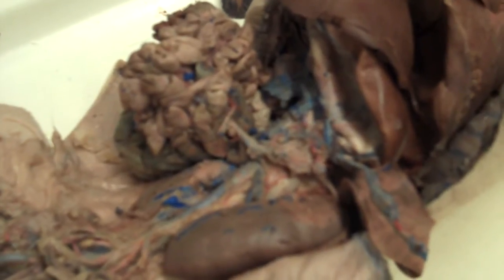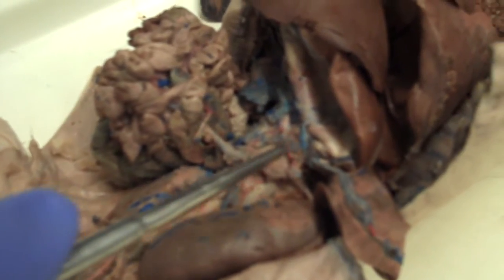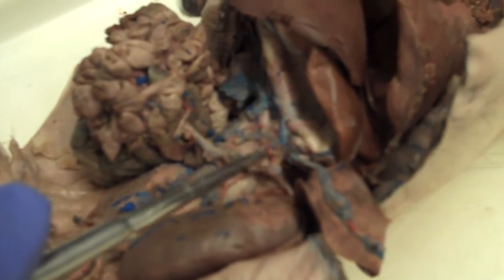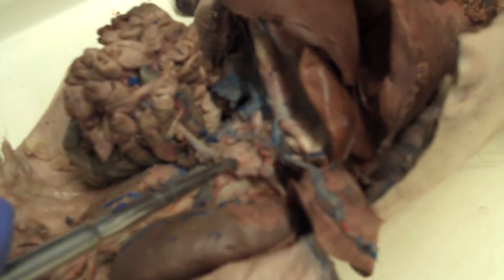Figure 4-6: ventral arteries and veins supplying digestive organs of the fetus. The first thing we have is the descending aorta, which we can see here. As you move caudally down the descending aorta, the first thing you'll come to is the celiac artery.